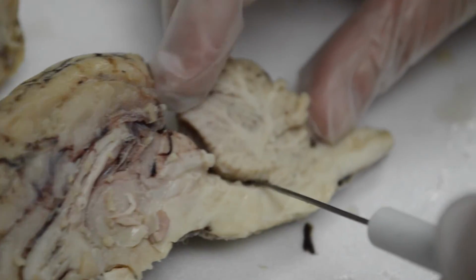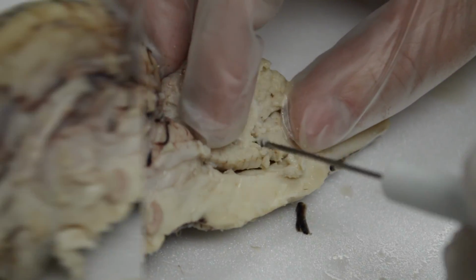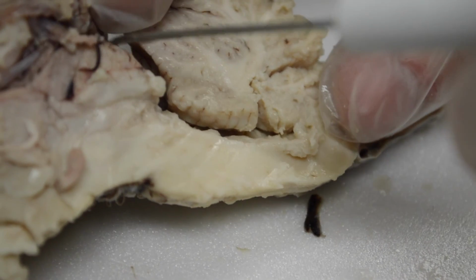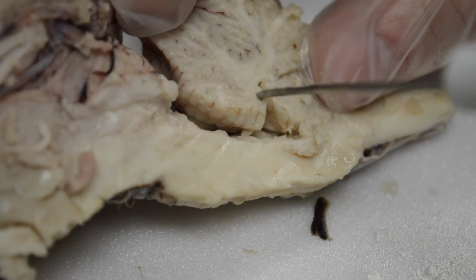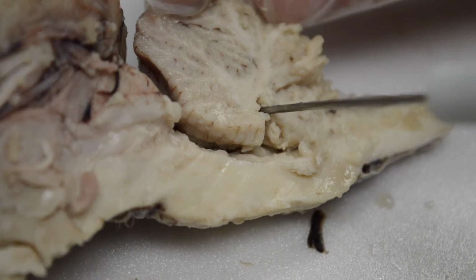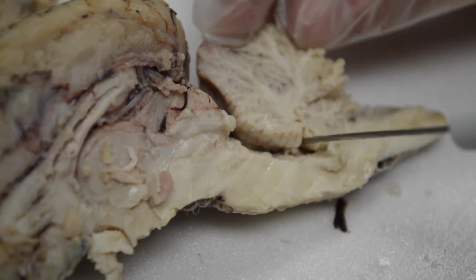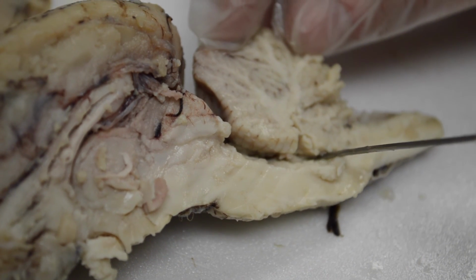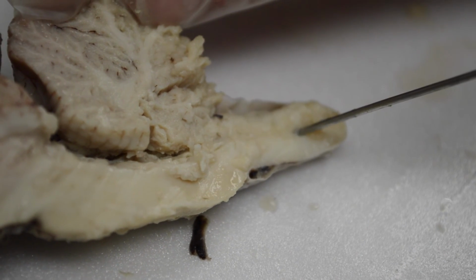Now, see if I can find the last structure. This is messy because this is kind of falling apart. Right here, this is the pathway that the fluid takes. So it follows, right, comes down, and in here is the fourth ventricle that goes into the cerebellum. So the fourth ventricle. So we have two lateral ventricles, a third ventricle, and a fourth ventricle is how they're named. And then this will come down and go through the central canal of the spinal cord.